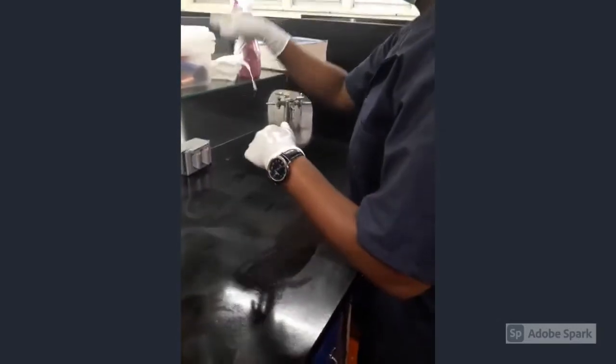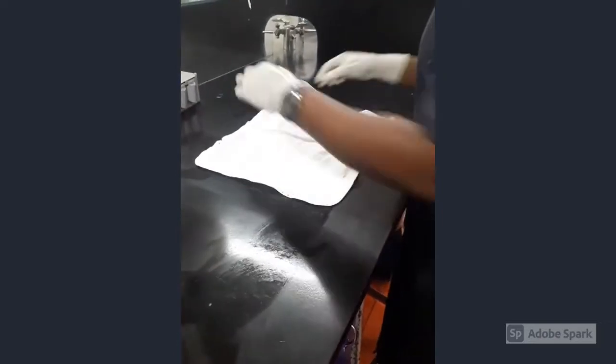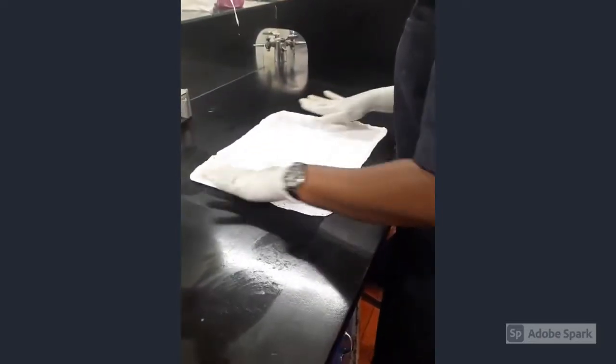So the station is ready and she's going to start to spread her white material on the table while she's going to start to remove her equipment and place them on the table.